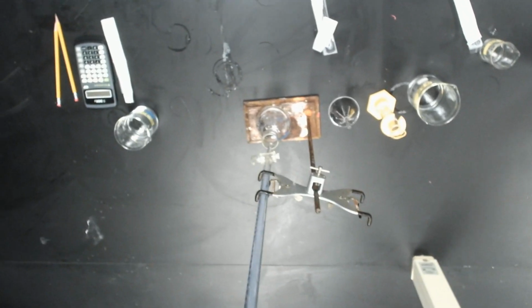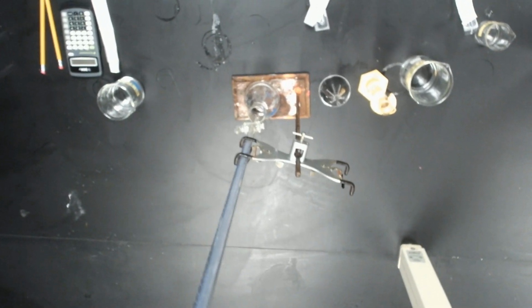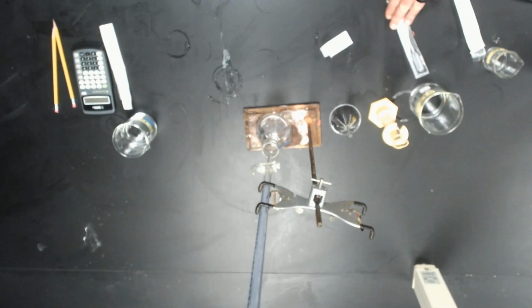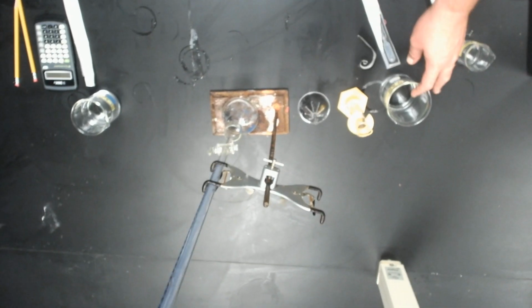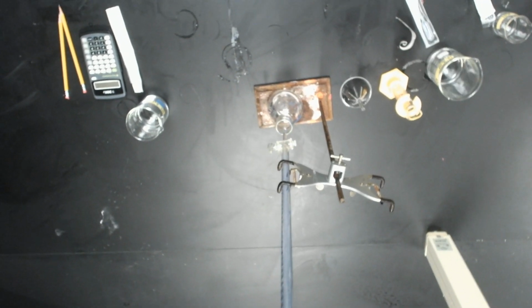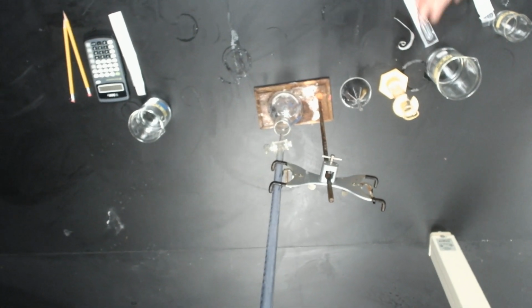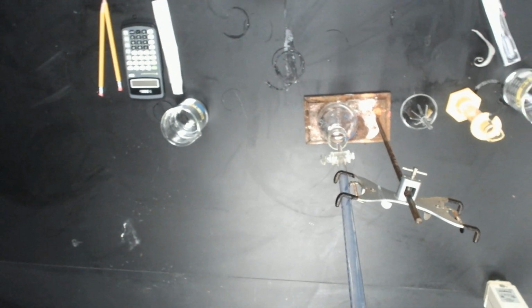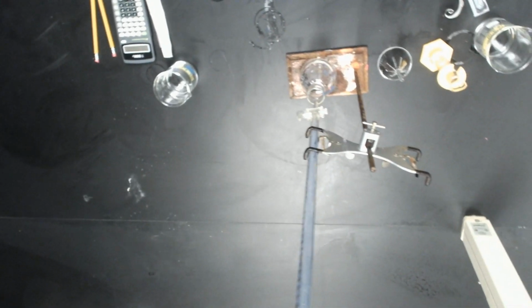There will be 6 different samples at 6 different stations. So, everybody will be doing one different. Okay, we also have right here, we're going to have our 1 molar NaOH. This is our base. We know this is our titrant. We know the concentration of that. We have a graduated cylinder, funnel, burette, right? Erlenmeyer flask, deionized water with a pipette, calculator, and a pencil.